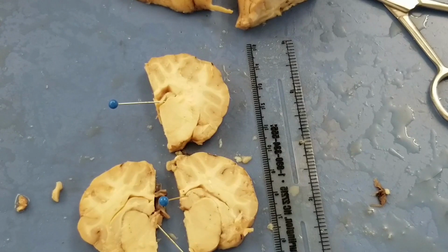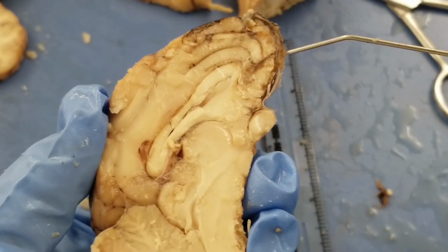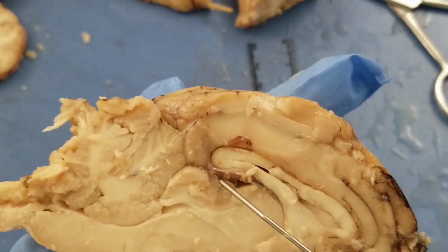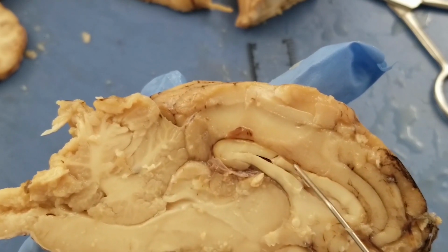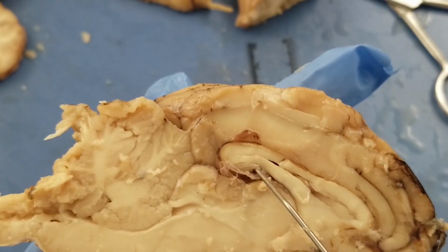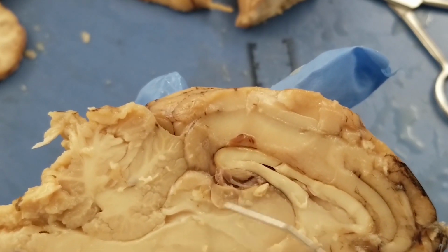And then next one, the last step. We need to trim a half brain so we can expose the superior colliculus, hippocampus, thalamus, and then we need to dissect out the hippocampus. So if you remember, we identified the hippocampus from the mid-sagittal view. It's a very small structure, it's here. And if you remember, this is a corpus callosum, right? And that is a fornix. So this part of thing is the top of the hippocampus. And then what is this little guy here? If you remember, that is a pineal gland.